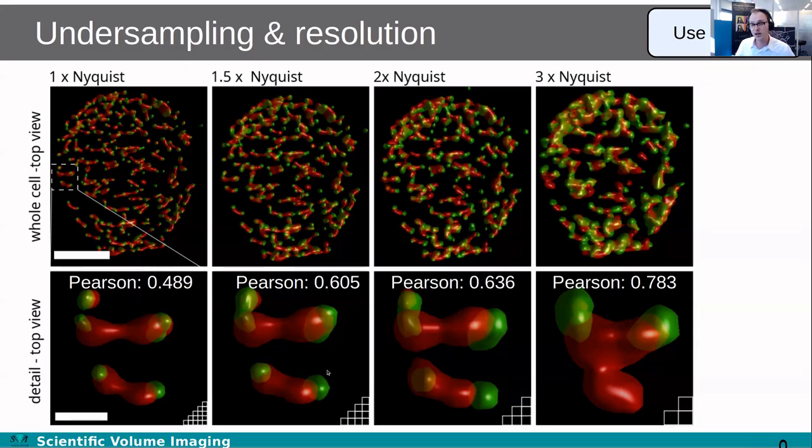What you can see, for increasingly bigger pixels, of course, the resolution gets worse. I see less detail, but you can also see the Pearson coefficient, as a measure for colocalization, going up. That is not because the biology is changing, just your resolution is getting worse, and that's causing objects that are really separate to start to overlap. That makes the Pearson coefficient rise, but it's not an accurate measurement. So we'd rather have a higher resolution if we can.